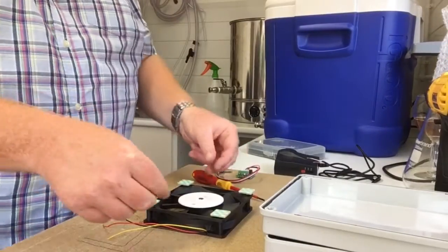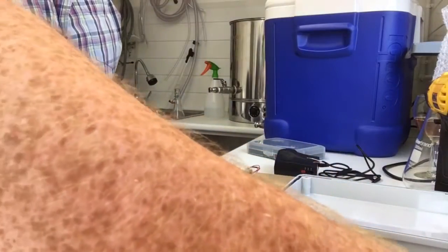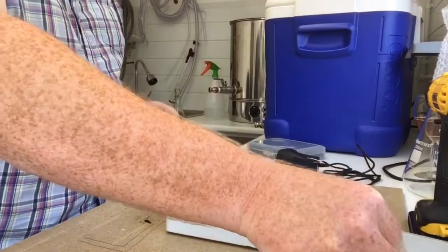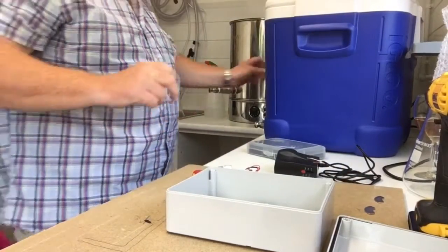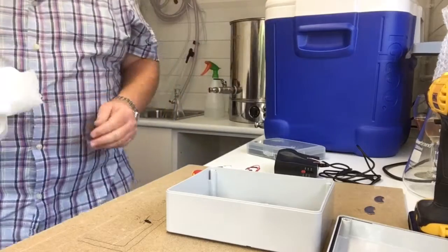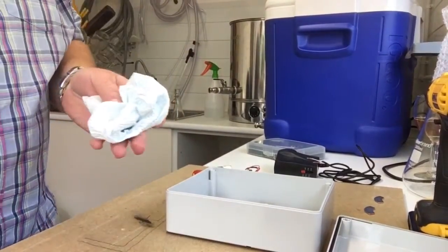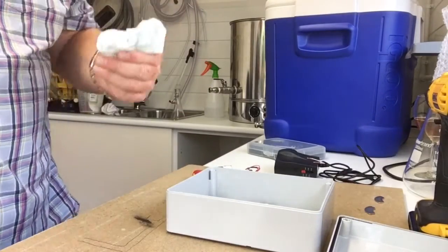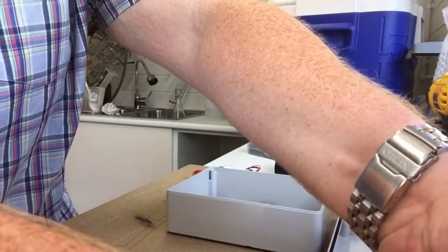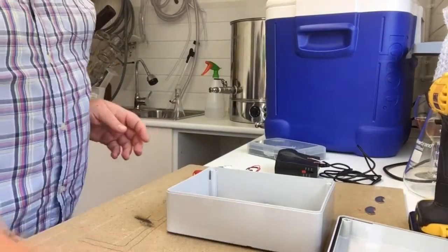Right, okay, I'm back. It's not completely set yet, but I'm just going to pop that to one side and get to work on my box. I seem to have successfully managed to get Grip Fill everywhere, which is typical. Sorry about all that.